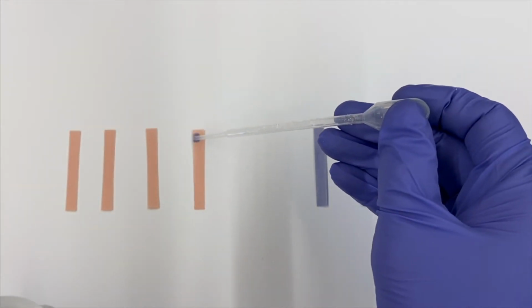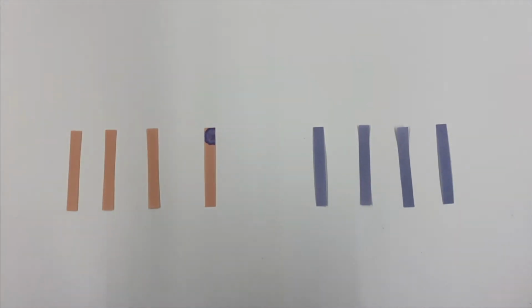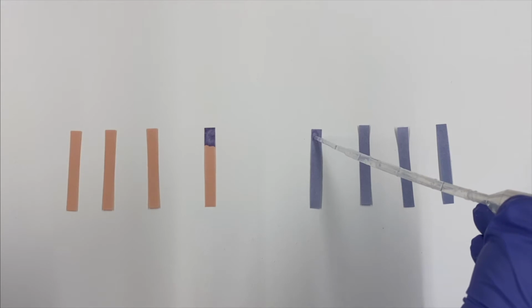All right, so if red turns blue, it means it's basic. B for basic. Still blue. Still blue, so it's basic.